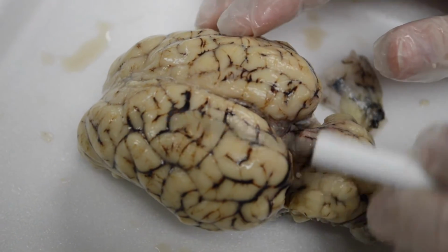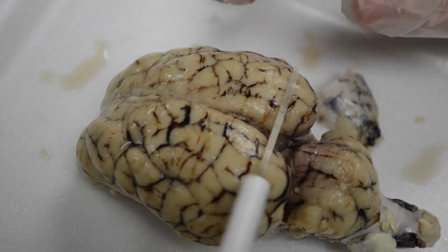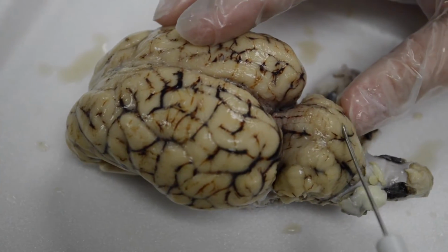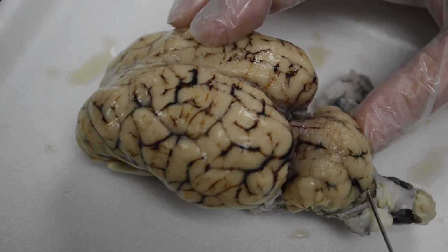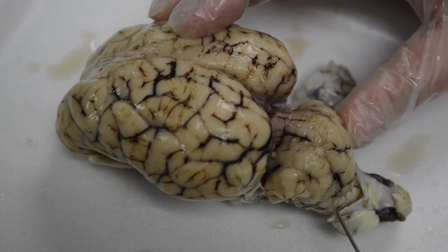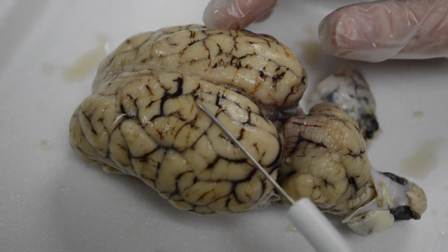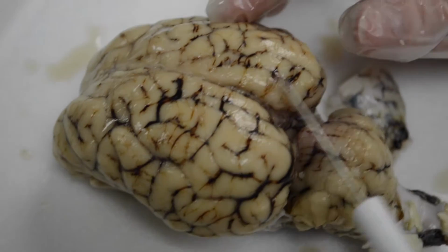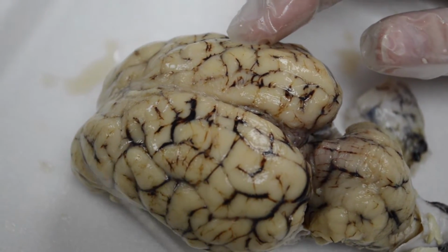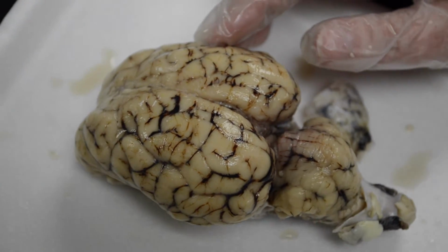Externally, we're looking at the dorsal surface of the brain. This is the cerebrum here. This whole unit is the cerebrum. And then the cerebellum, the little brain. And this is the spinal cord at the bottom. We'll look at the brain stem, which we can see better on the ventral side. The shiny surface that you see that looks kind of painted or shellacked, that's the pia mater. Okay. So we have cerebrum, cerebellum, little brain.